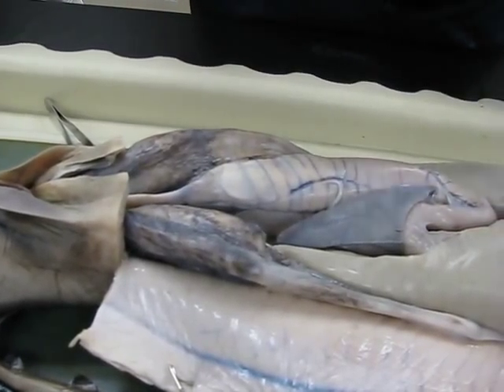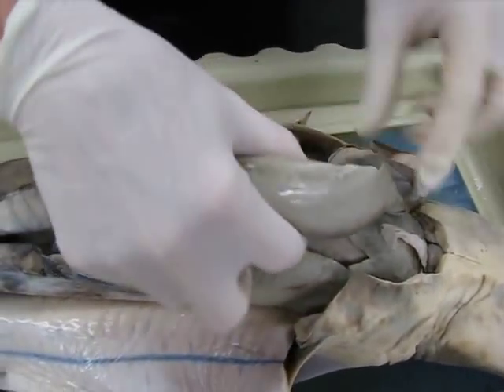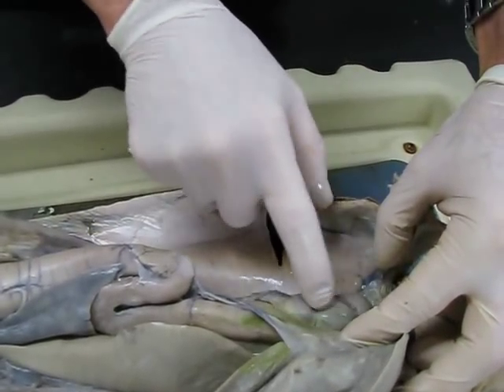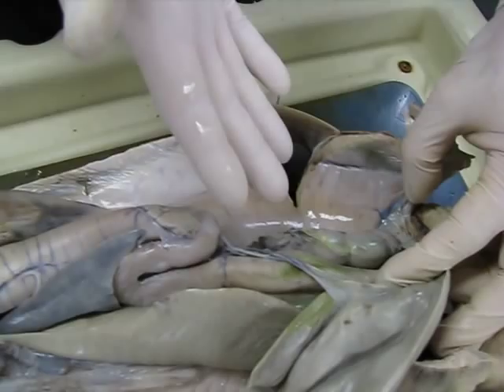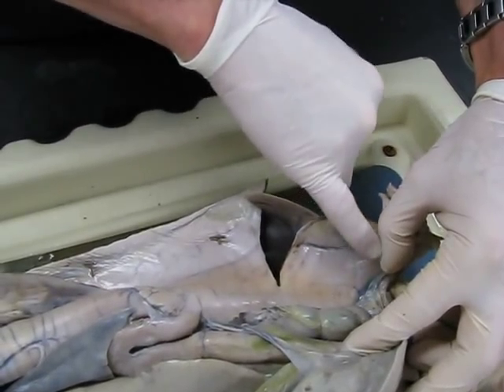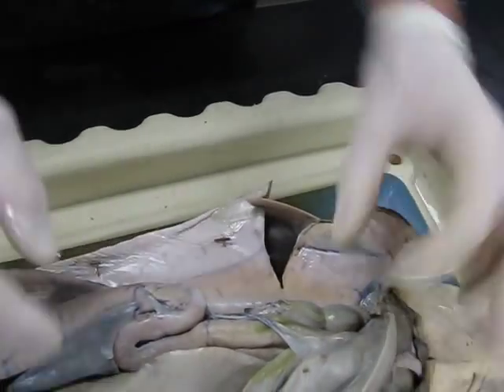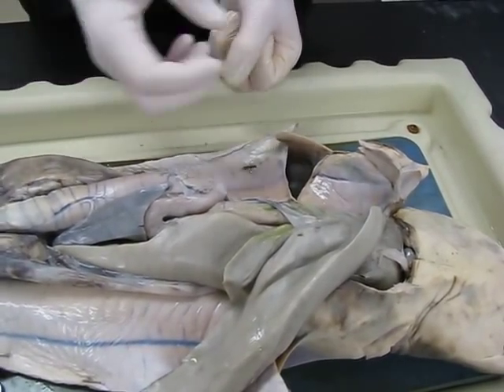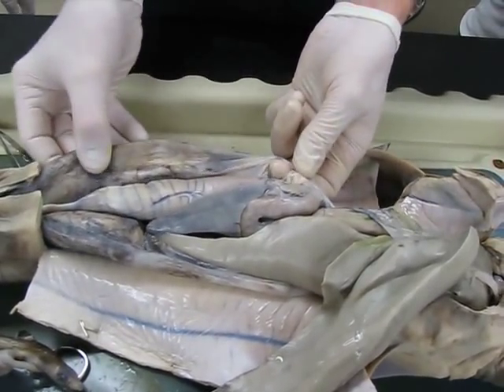Female anatomy. First of all, no claspers, but if you lift up this massive liver and look underneath, what you're going to see is there's an ovary with eggs all being ready to ovulate. That ovulation occurs and when the egg is ovulated, it goes into the coelomic cavity. So all of this is the coelomic cavity and they are just released from the ovary.